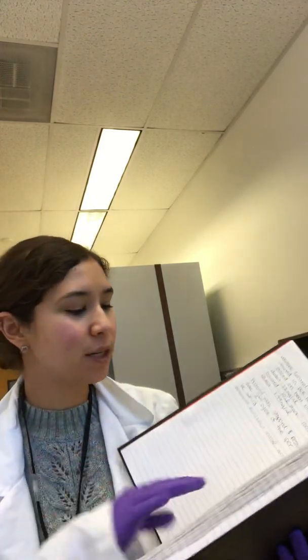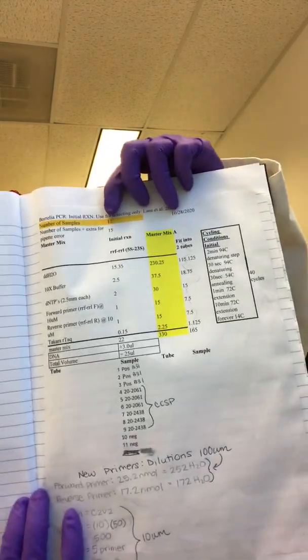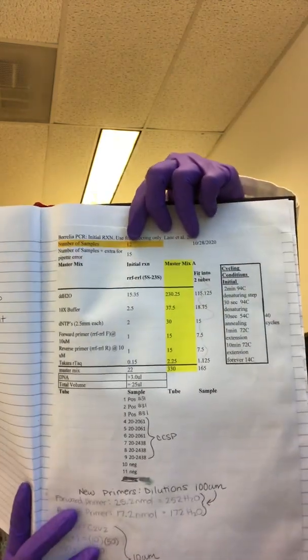Today we're talking about how to do a nested PCR in our lab. So the first thing you need to do is to go online and create a PCR template or follow your PCR template. And after you've filled it out, make sure to print it out and put it in your lab notebook like here. So in this orange area, you are going to put the number of samples you plan to run plus 2 negatives up here. So if I'm running 10 samples, I'm adding 2 more up here for our negatives.